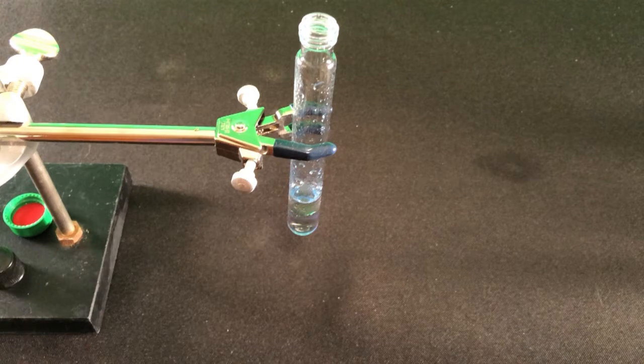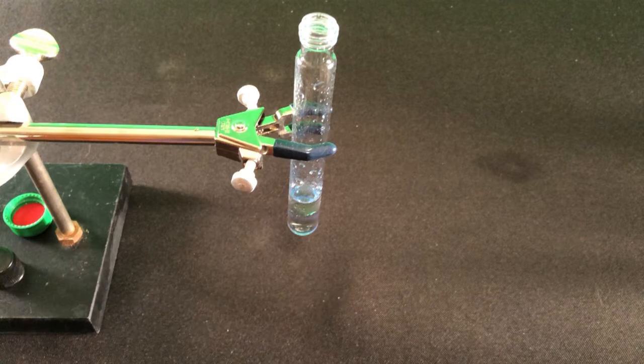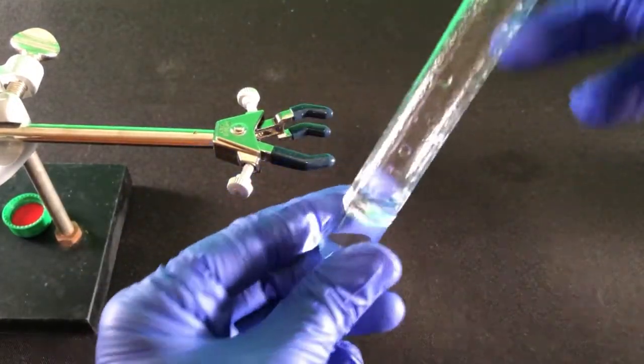Mixing frequently causes pressure to build up inside the test tube, particularly if volatile solvents are used, like diethyl ether, or if you use a solution that can generate gas, like sodium bicarbonate in acidic conditions, where CO2 is released. Cap the test tube and shake vigorously for several seconds. Make sure the cap is on tightly.